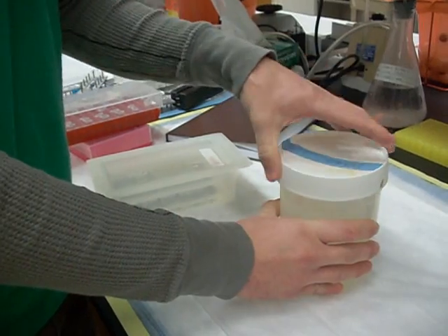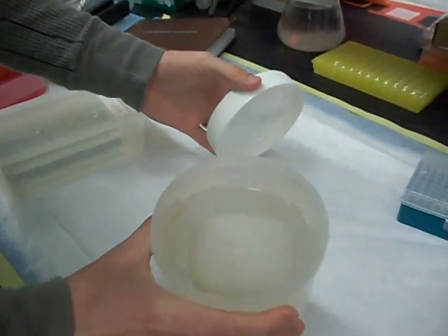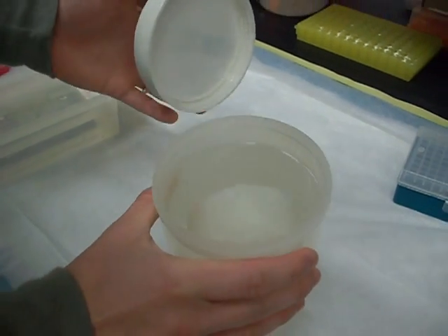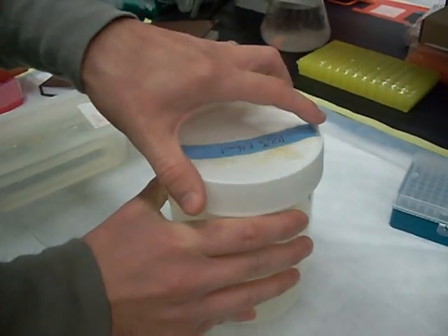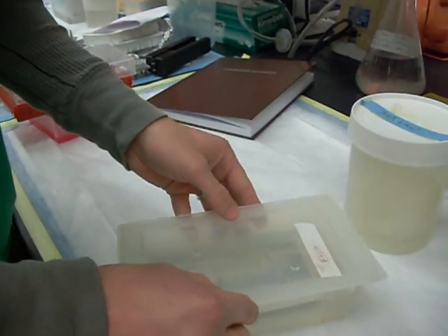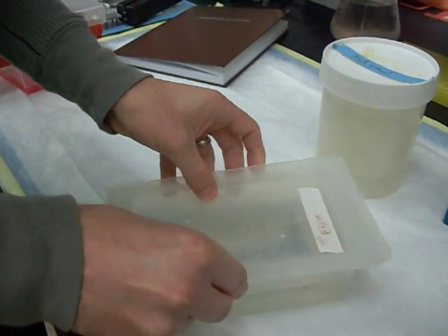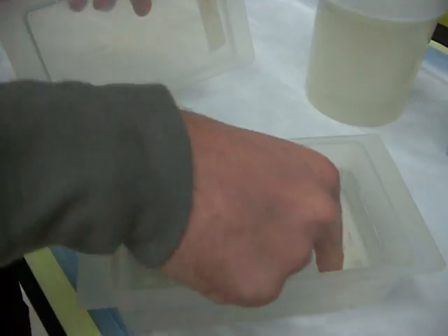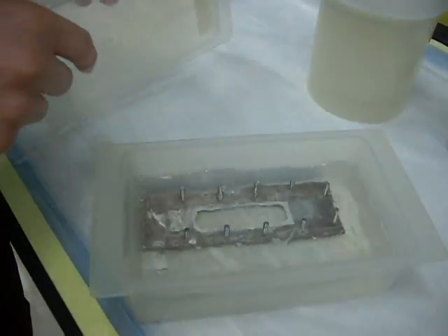We'll also store a pulse dampener if we're going to decide to use one in ethanol, and we'll have that stored for days before the experiment just to keep it disinfected and try to keep any contamination out. An hour or so before the experiment we'll also try to disinfect the flow chamber as well as the gasket by soaking in 100% ethanol.